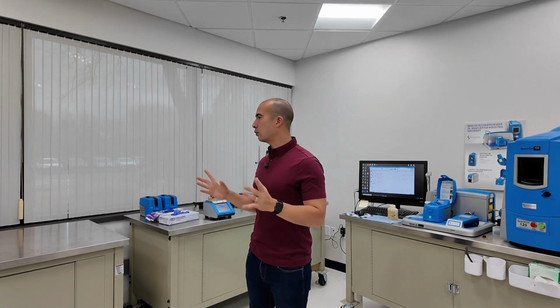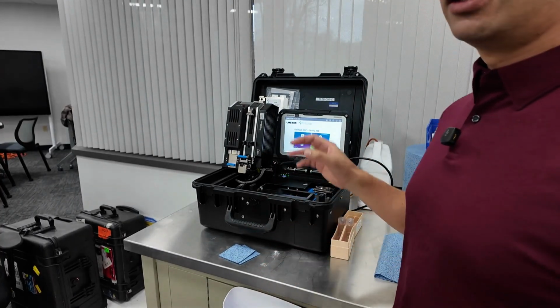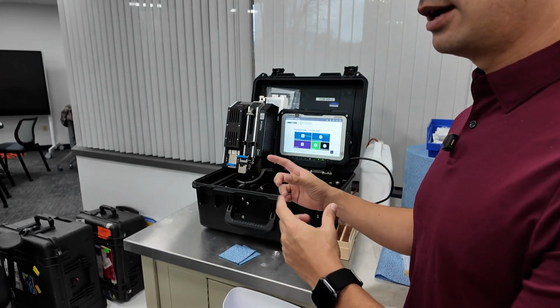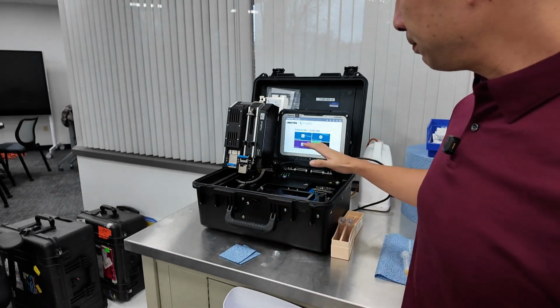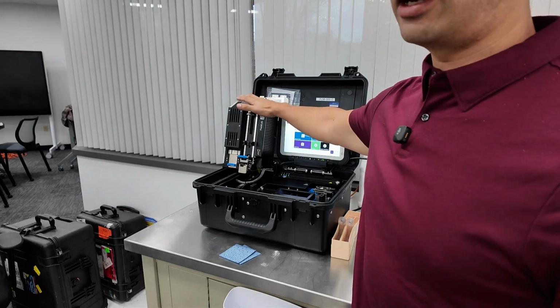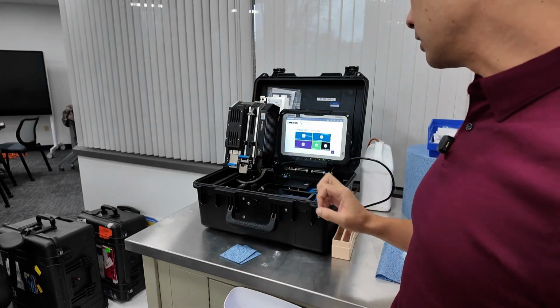All right, so let's start with probably the FieldLab. This is the FieldLab 58. There's a couple of different versions of the FieldLab. One of them is the 33, this is the 58. The 33 is going to do basically infrared, as well as viscosity, as well as ferrous density. This one's slightly different. We're going to do viscosity, as well as infrared, as well as a particle count, as well as a kind of elemental analysis, which is a little different to what you'd see on an ICP or an OES. We'll get into that in a second.